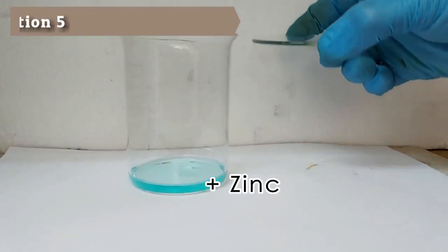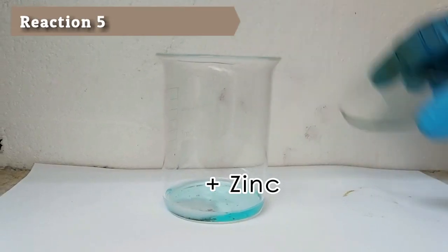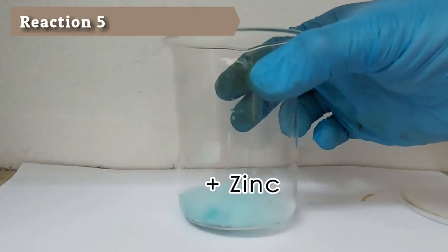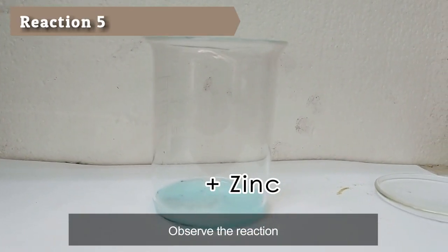In the fume hood, add all at once 0.4 gram of zinc metal, stirring until the supernatant liquid is colorless. Record your observations.